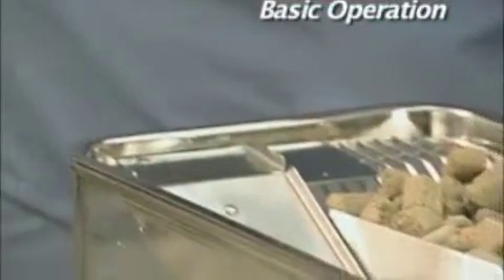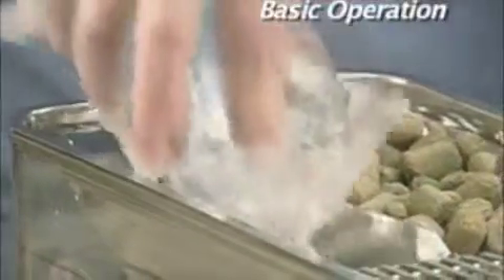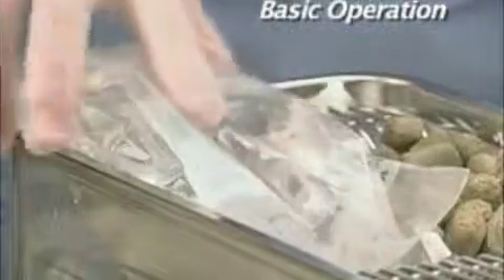The Sipper Sack can now be inserted, valve side down, in the supplied liner of the wire bar lid, just as you would a water bottle. This process can be repeated with each animal cage change.